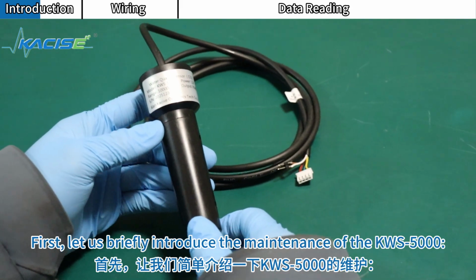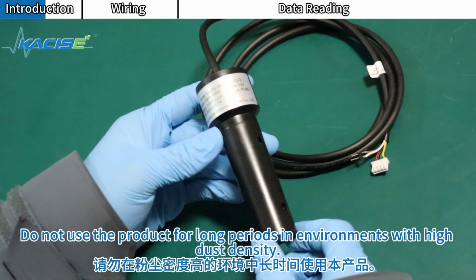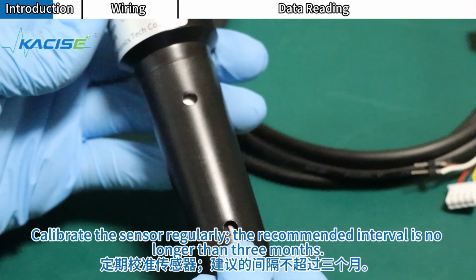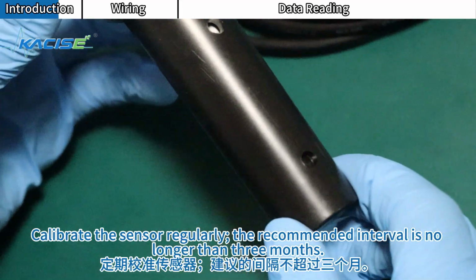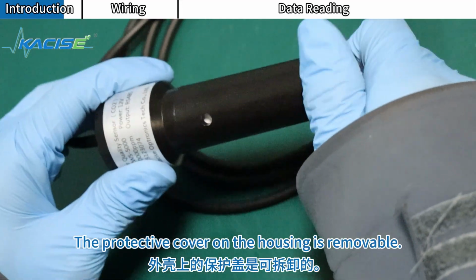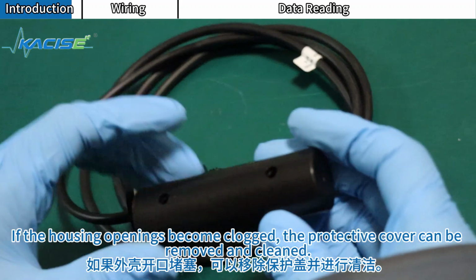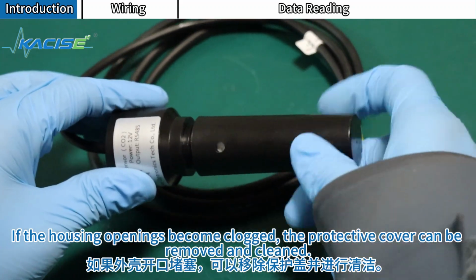First, let us briefly introduce the maintenance of the KWS-5000. Do not use the product for long periods in environments with high dust density. Calibrate the sensor regularly. The recommended interval is no longer than 3 months. The protective cover on the housing is removable. If the housing openings become clogged, the protective cover can be removed and cleaned.